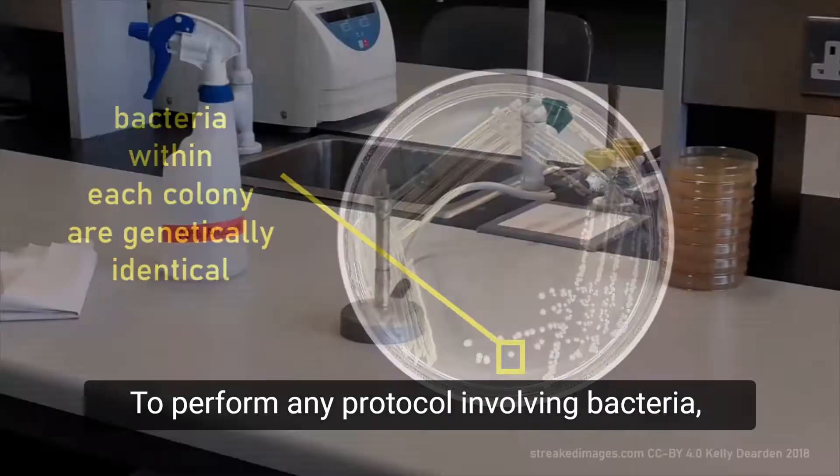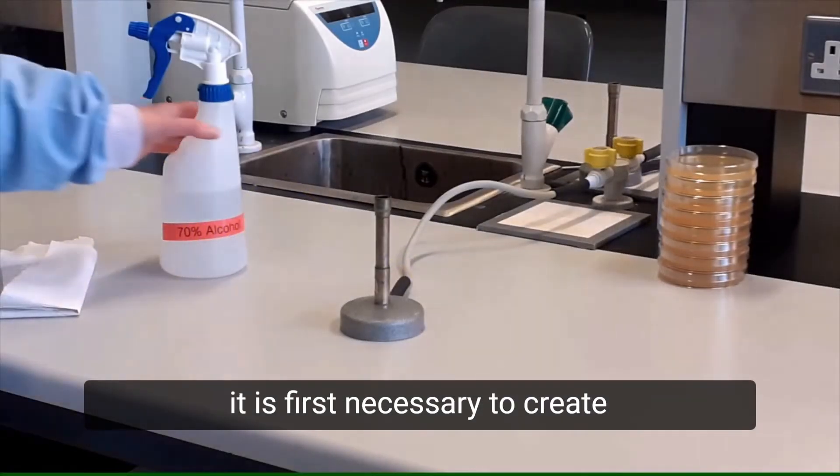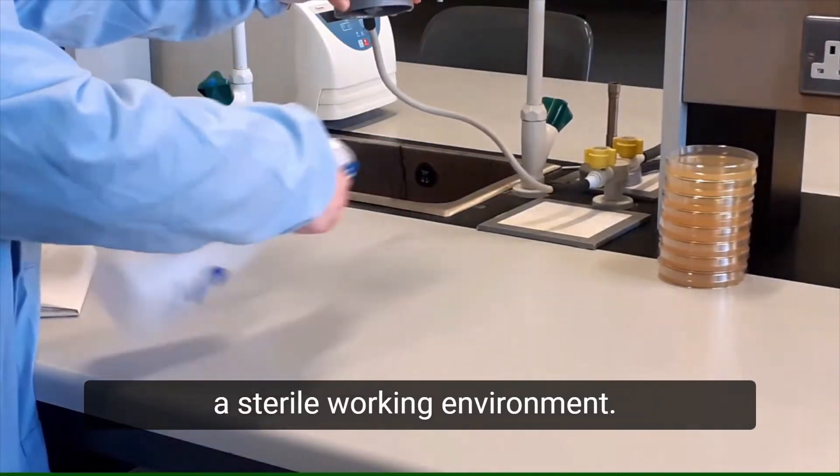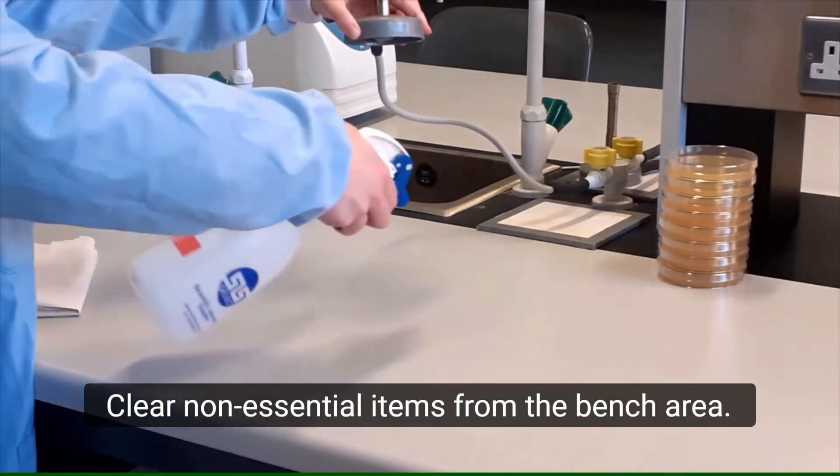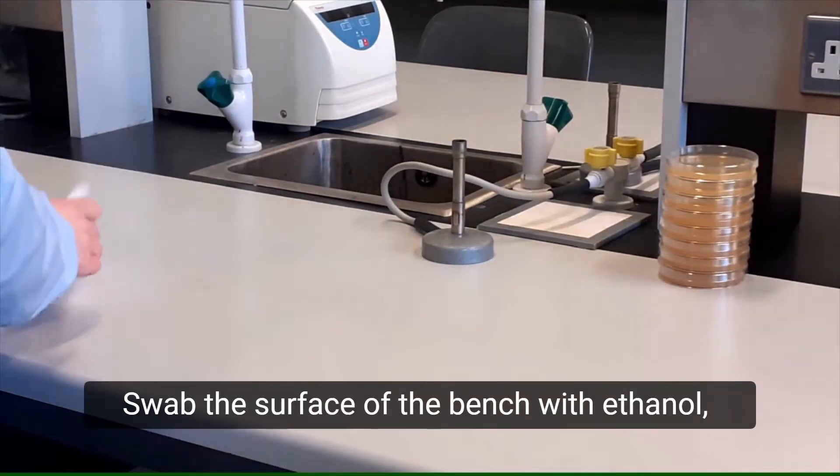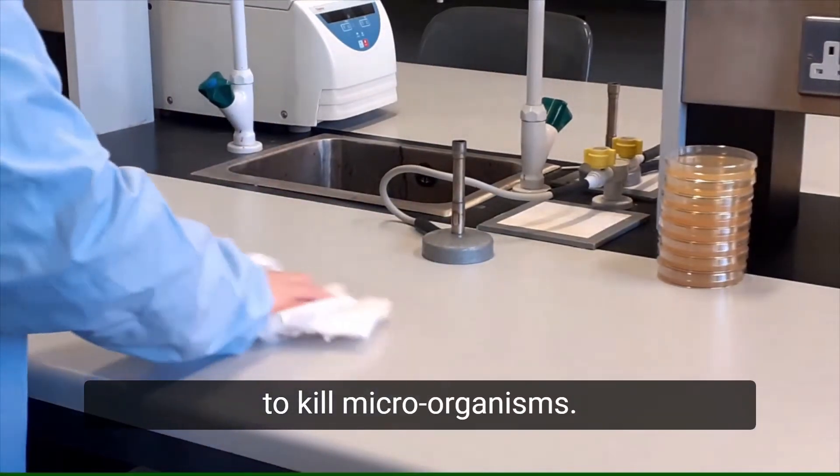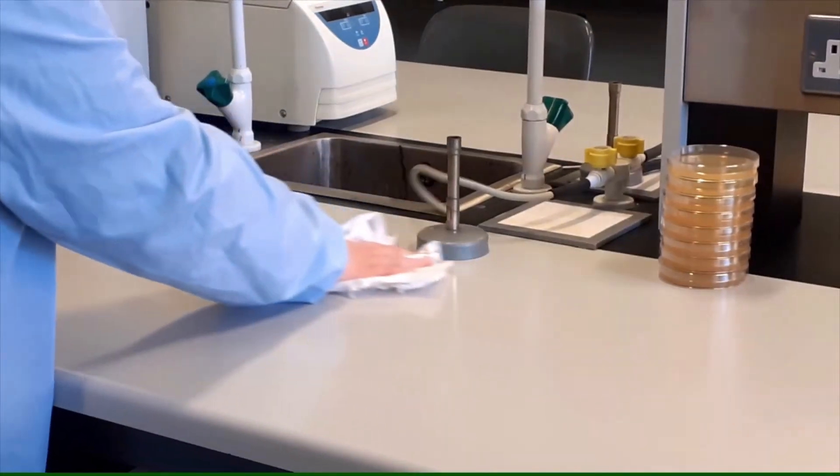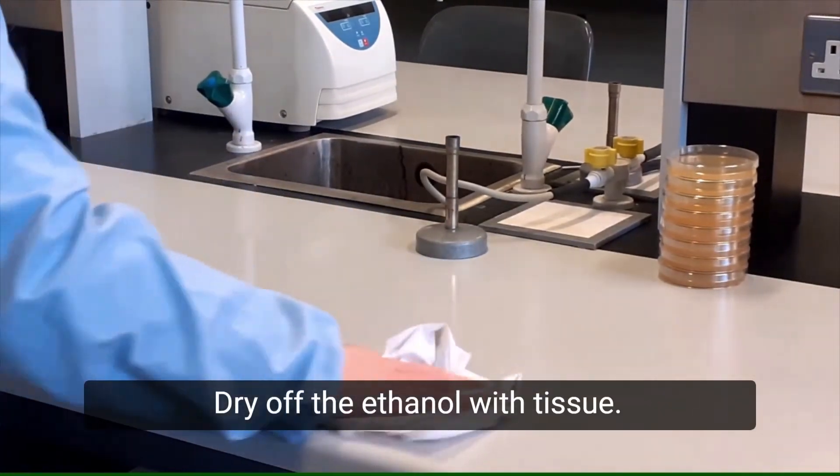To perform any protocol involving bacteria, it is first necessary to create a sterile working environment. Clear non-essential items from the bench area. Swab the surface of the bench with ethanol to kill microorganisms. Dry off the ethanol with tissue.